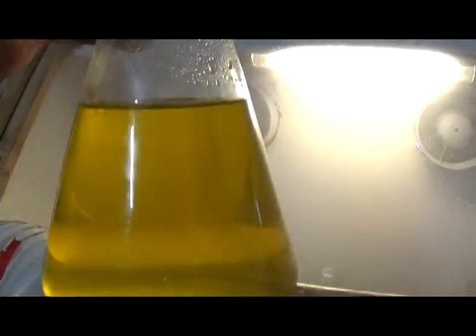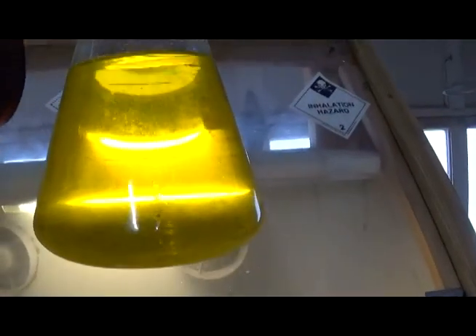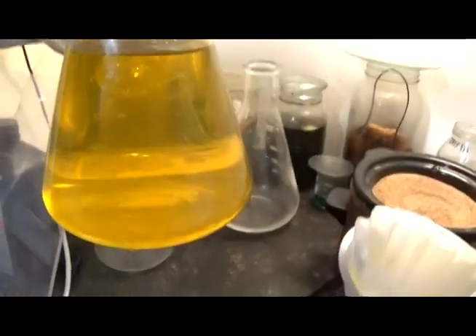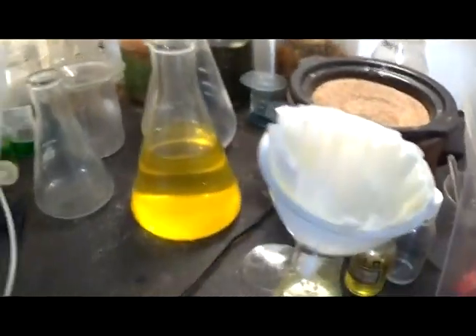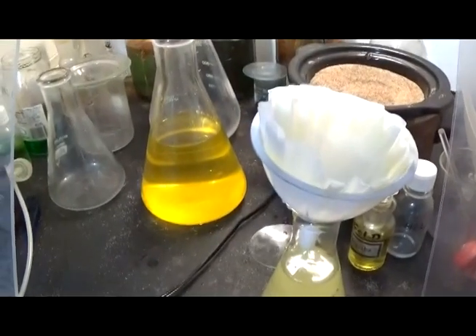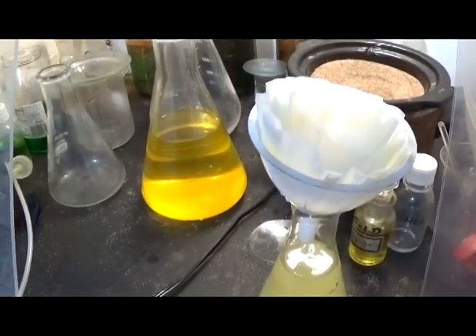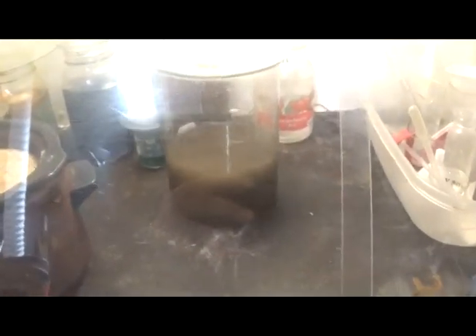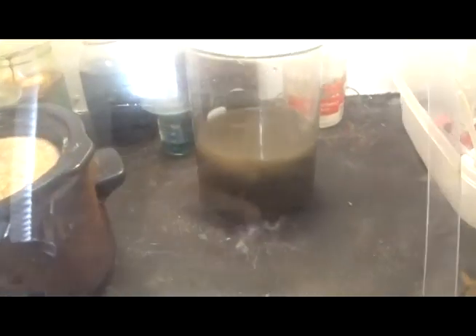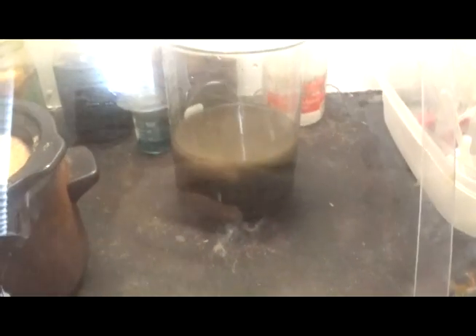All right, we don't have the cloud. We may have actually filtered this correctly and got rid of, I don't know about all the tin. Maybe all the tin, but I'm not ready to brag like that. This is heavily contaminated with tin. Now we're going to clear all this out, get us some room, and get us a large beaker, and we're going to drop this gold. That's what we're going to do. And I'm sorry I didn't show you the actual dropping of the SMB, but I just dropped it and stirred it. So we're going to get us a nice gold drop here.